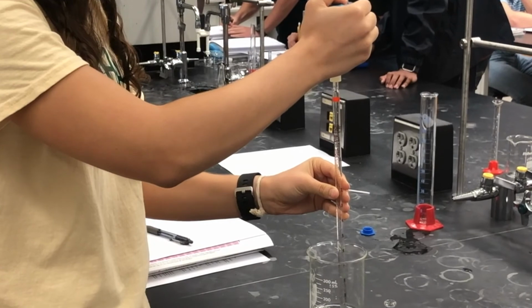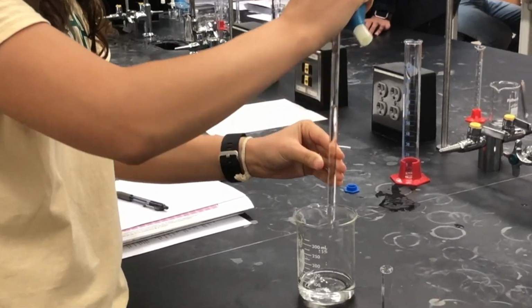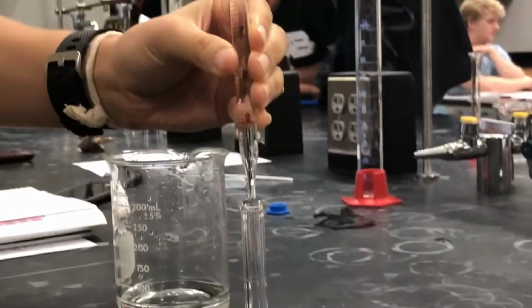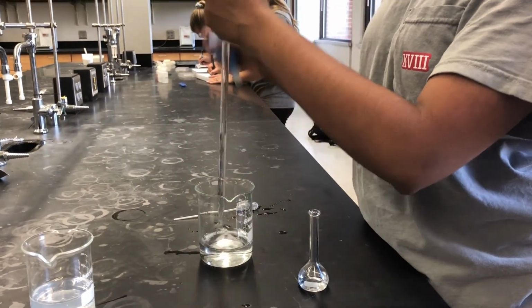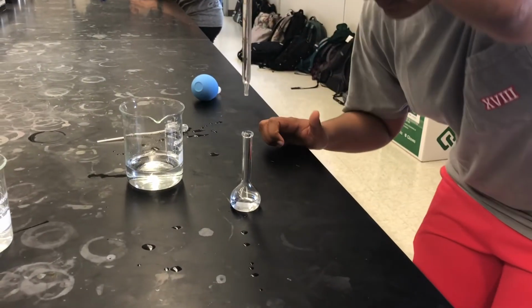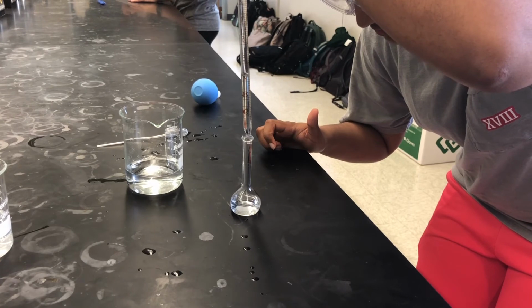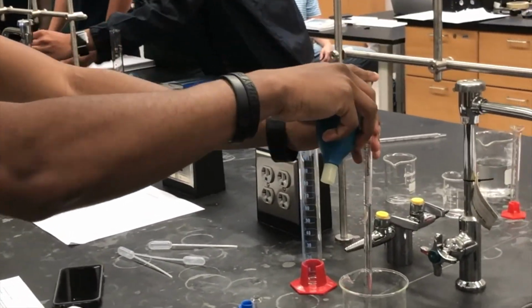We had to repeat all of the steps shown in the technique part of this video 3 times to perform dilutions for 3 more samples. Here you can see how each of our group members used the pipette to obtain stock solution and transfer it to the flask. Each member made sure to record the initial and final volume of the stock solution. Then, the flask was diluted with water, and the rest of the steps that were performed in the first dilution were repeated for each of the next 3 dilutions.